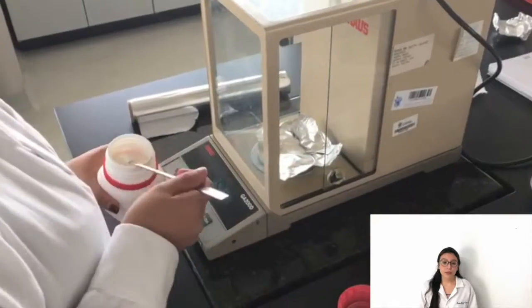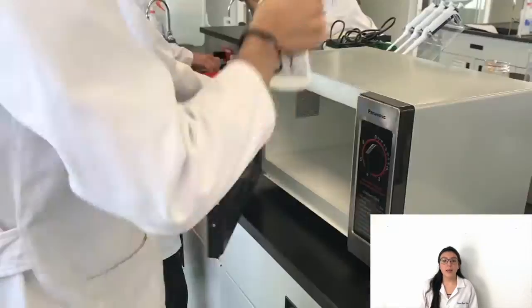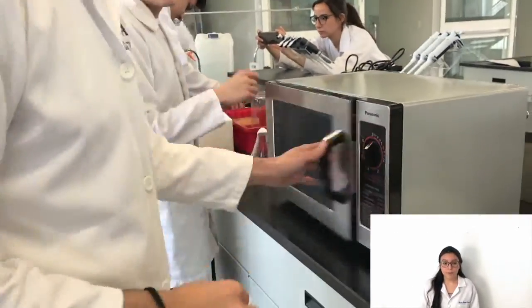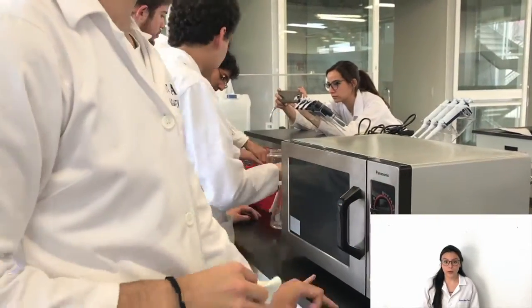Methodology. Make the necessary calculations to prepare the assigned agarose gel: 0.8%, 1.6%, or 2.5%. Weigh the agarose and dissolve it with 1x TBE buffer or 1x TAE in the microwave. To prepare a gel in the electrophoresis chamber, 50 ml of TBE buffer or TAE are required.